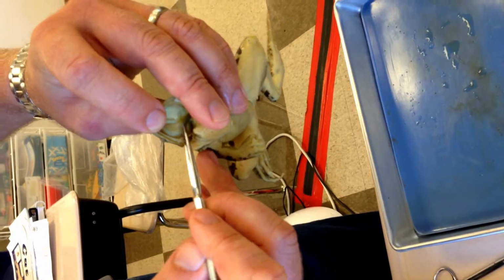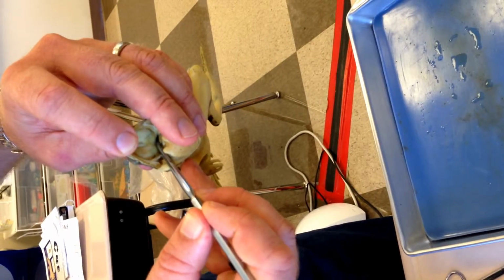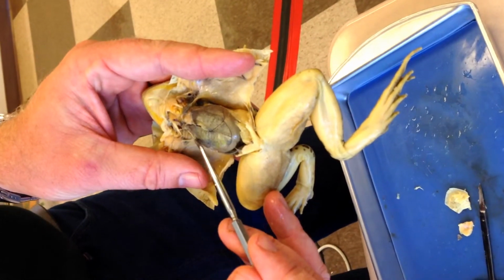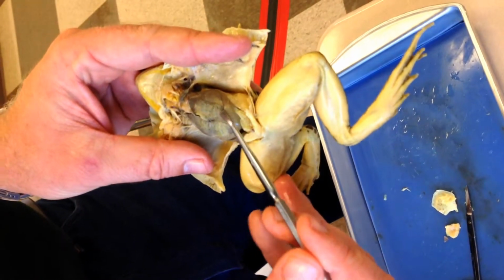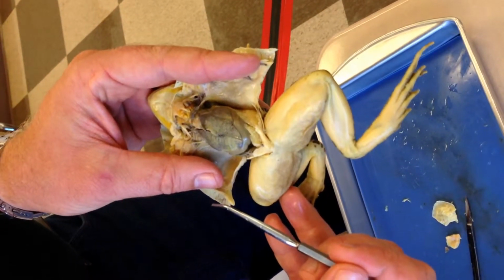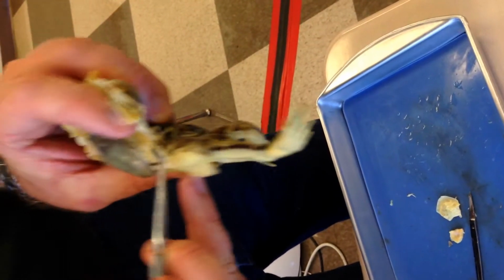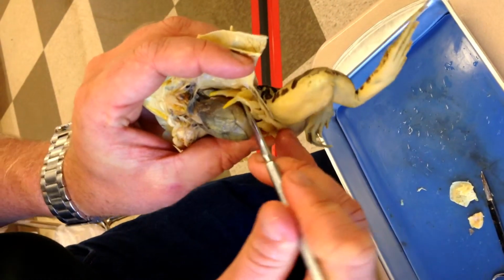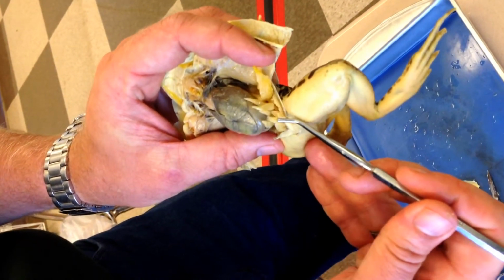Number eight, there's an opening above that that goes down to the stomach. Number eight. When you open the frog, you see first three lobes of this organ. Number nine is what is this organ that takes up most of the superficial view of the body cavity. Number nine. Number 10, there's a bunch of this yellow fingery stuff. You removed that, and I will too in just a moment. Number 10, what is all this yellow fingery stuff?